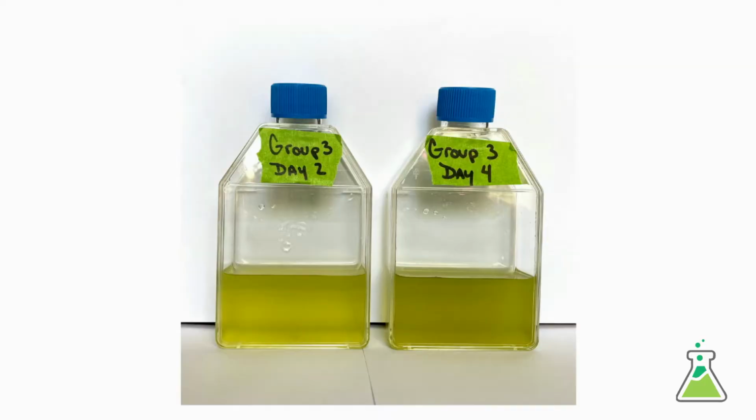And then at the bottom, just like we did on day 2, it's asking us to describe the culture in a qualitative way, or in observations. And so it's nice, we're going to flash up a picture here. We took a picture of your culture on day 2 and a picture of today on day 4, and we put them side by side so you can compare them. So in here, for this qualitative data, I want you to compare what your culture looked like 2 days ago with what it looks like today.